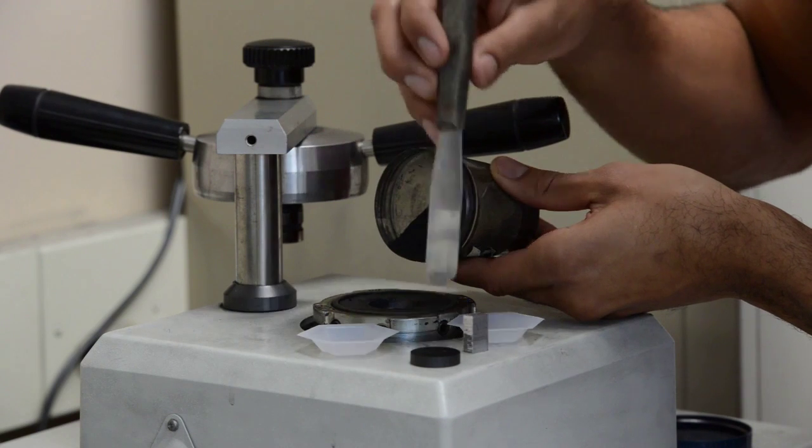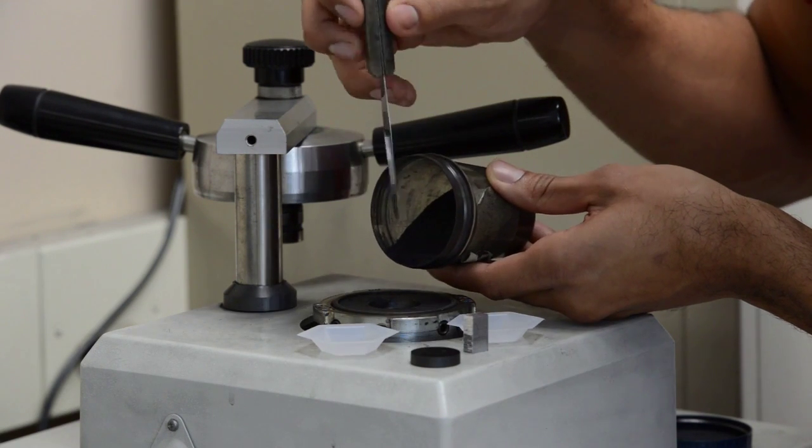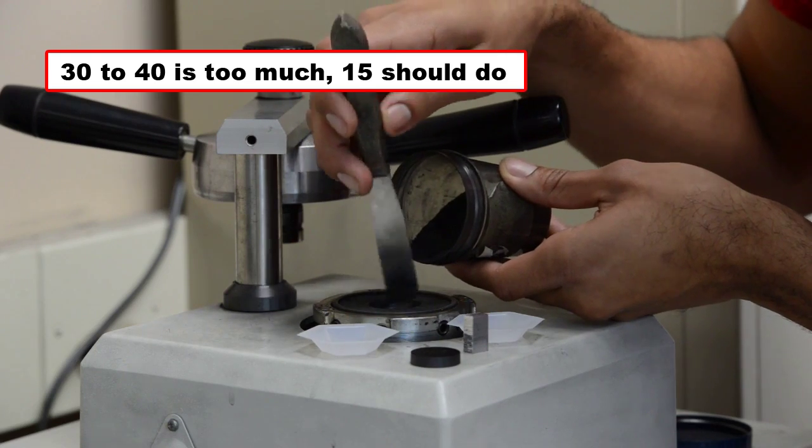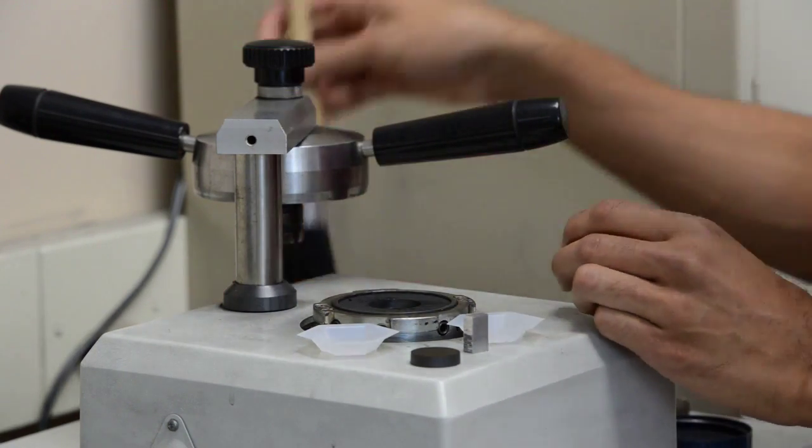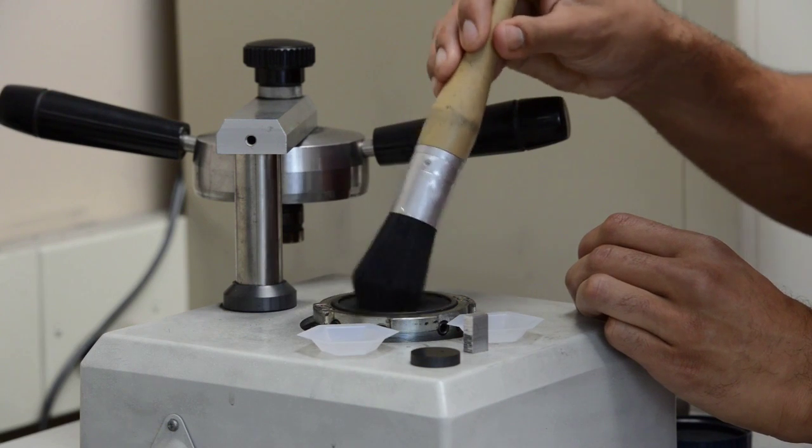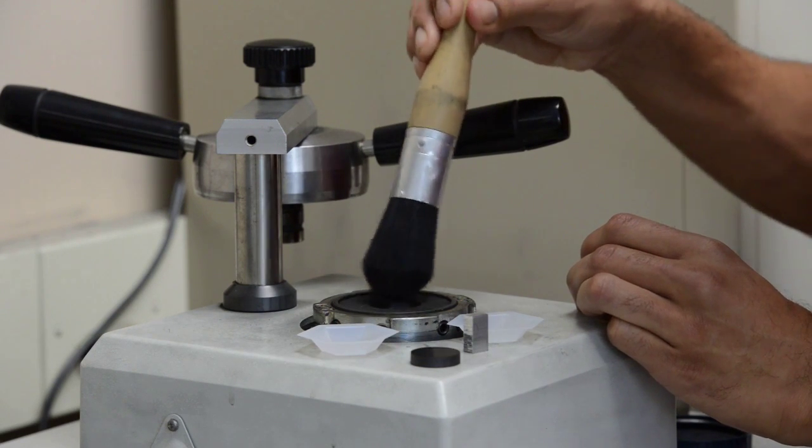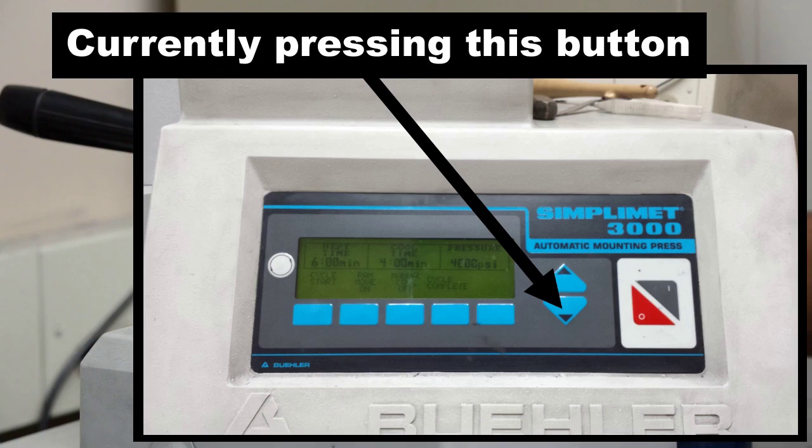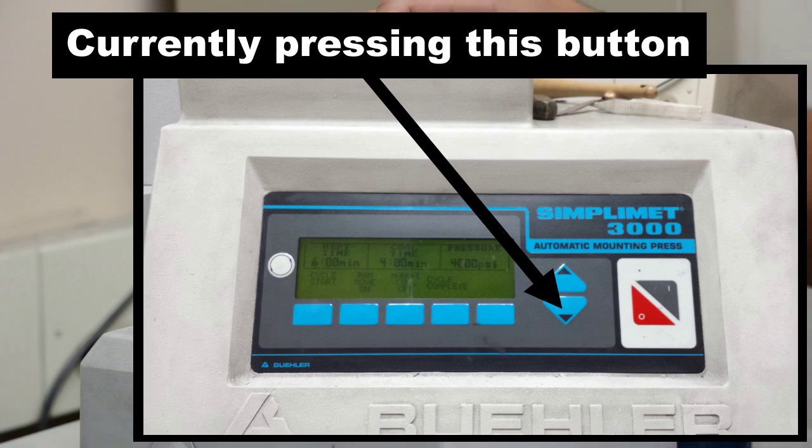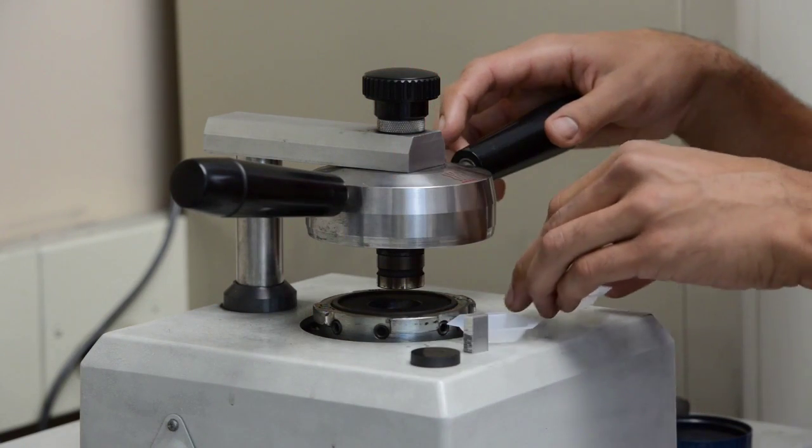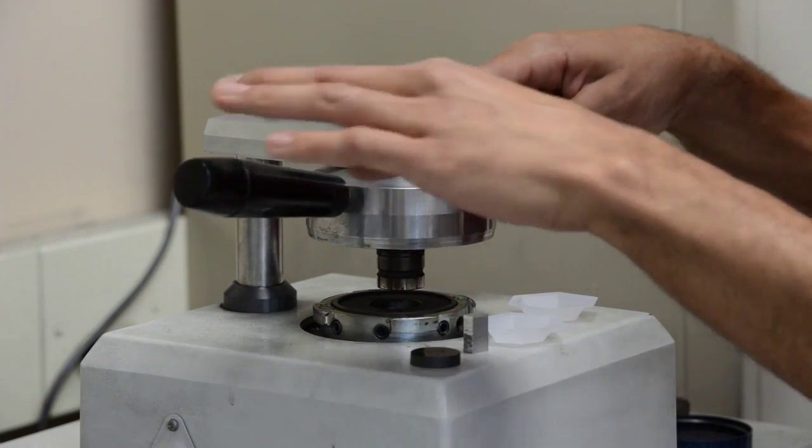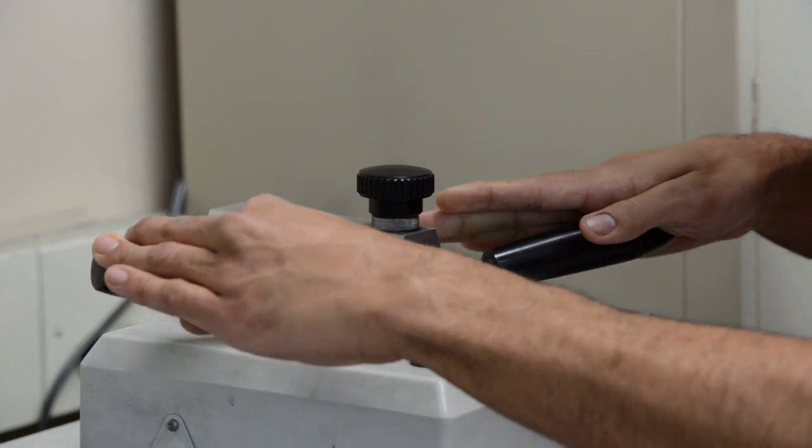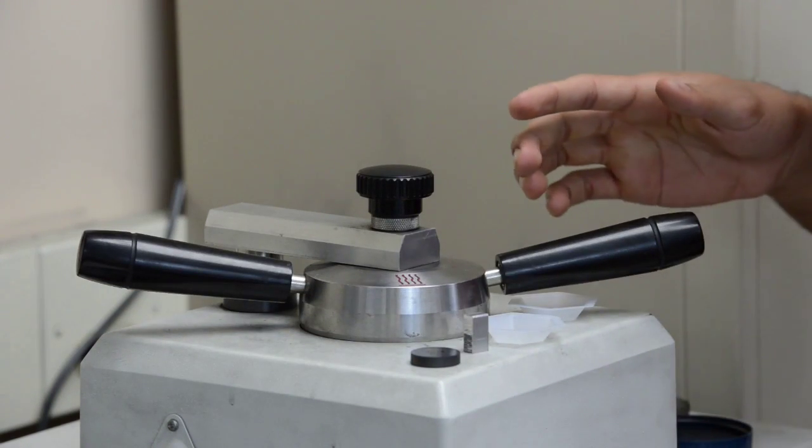Here's where it is important that your dummy puck is sanded down, or else it will have a hard time going in. But this one went in just fine. And now I can add my powder conductament. And just make sure you add enough. That should be enough. If my dummy puck was 10 grams, I probably want to add around 30 to 40 grams. Now I want to lower this even more. And take this down, twist it, and start your cycle.